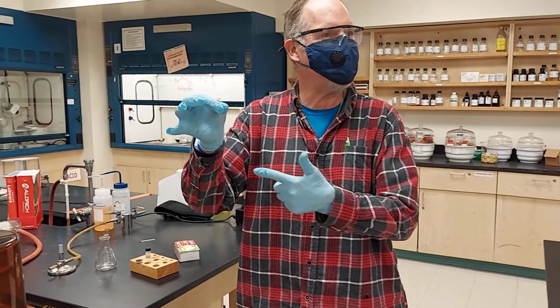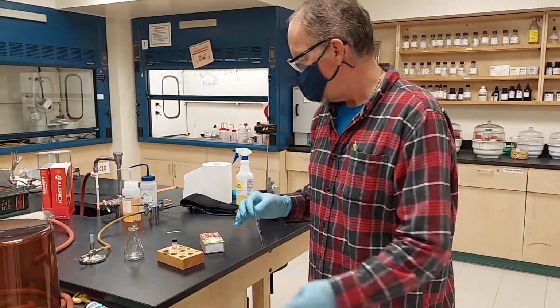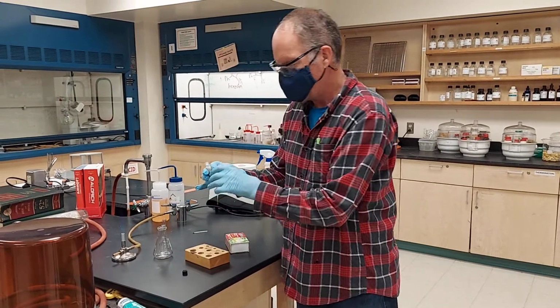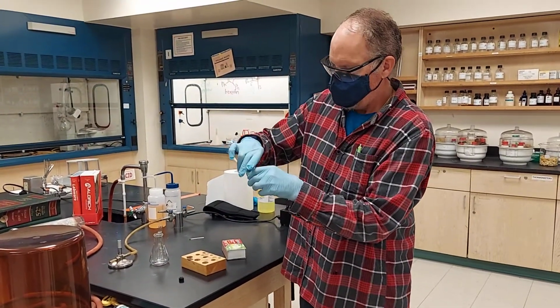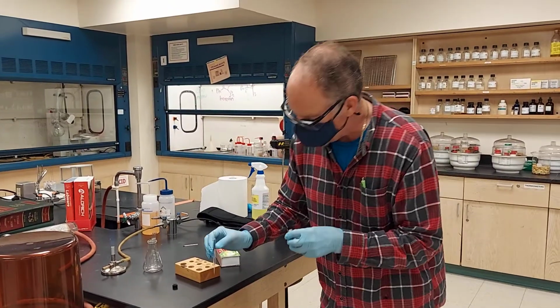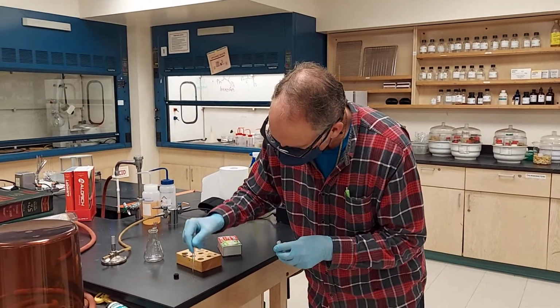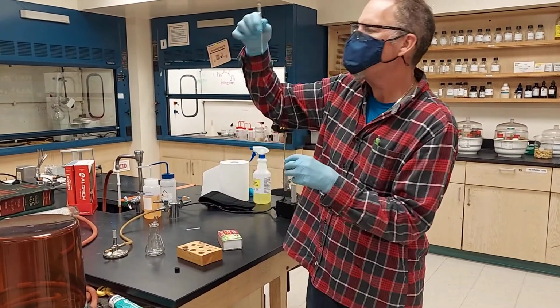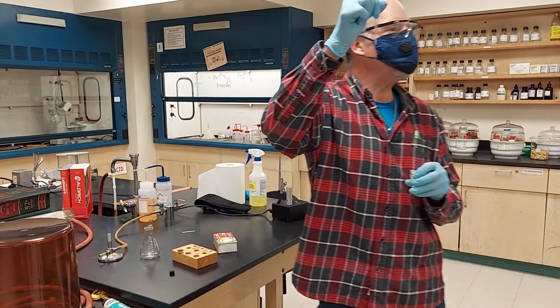It's pretty hot right now. I'm going to put caffeine in there, caffeine from our sample. Enough for a melting point. Now my job is to get rid of the air.